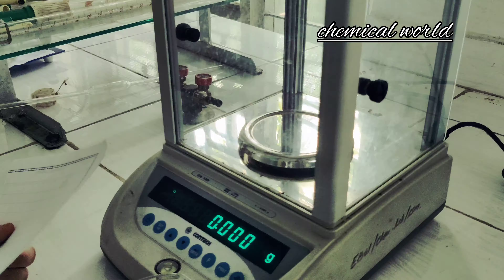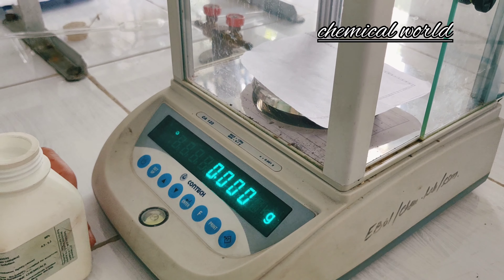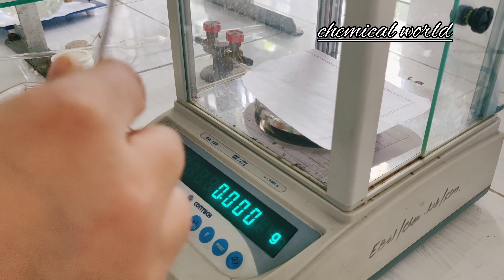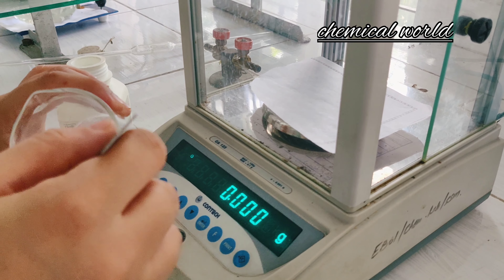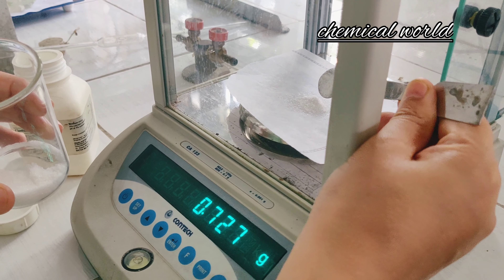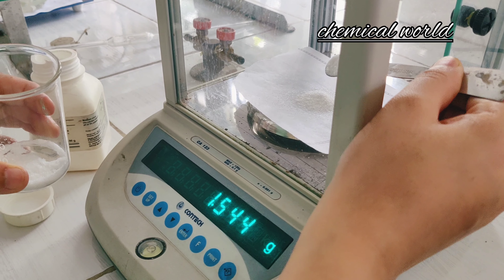you need to weigh 3.723 grams of the disodium salt of EDTA, having a molecular weight of 372.25 grams. Now weigh 3.723 grams of EDTA. Let me tare the weight of the paper first and set the balance at zero. Now I need to weigh 3.723 grams of this EDTA.